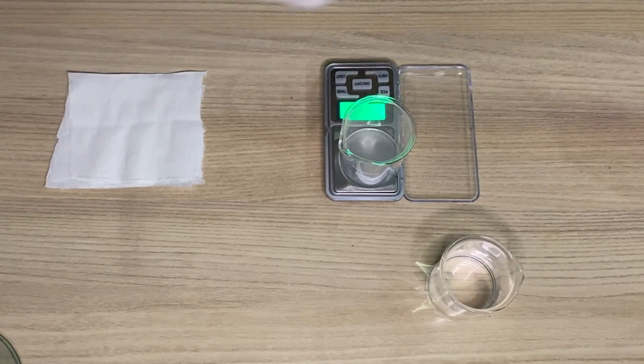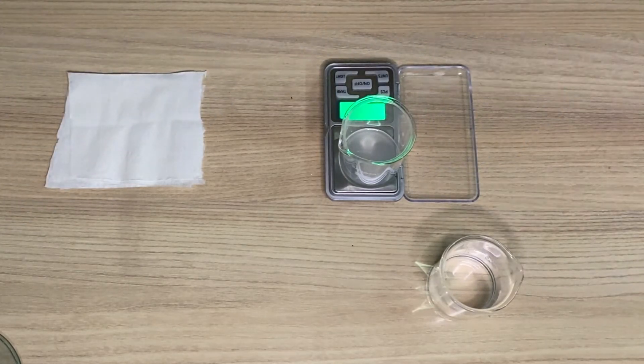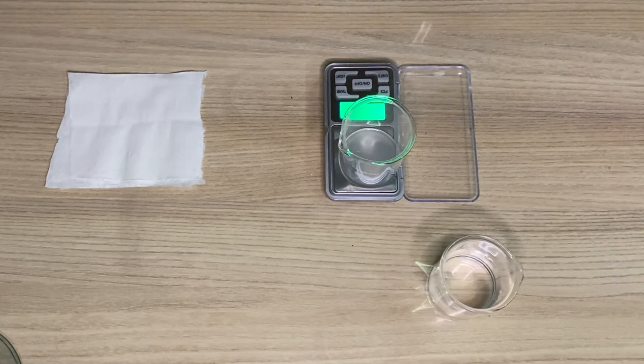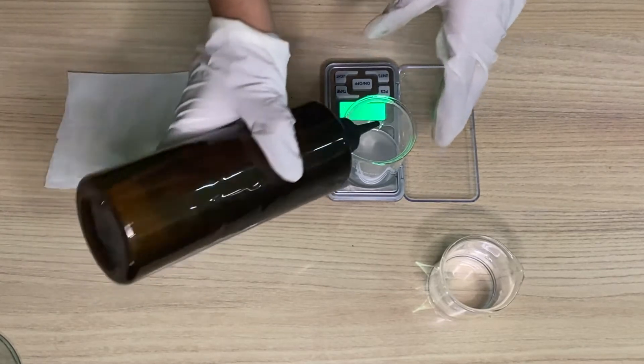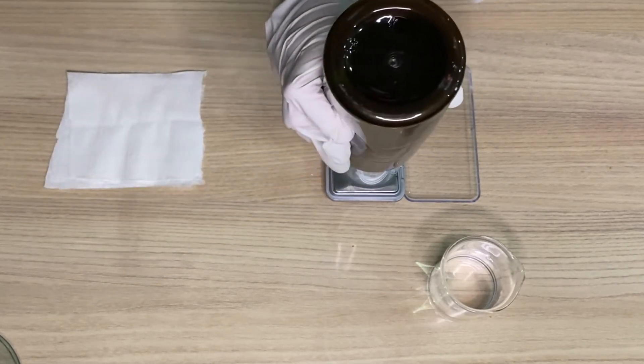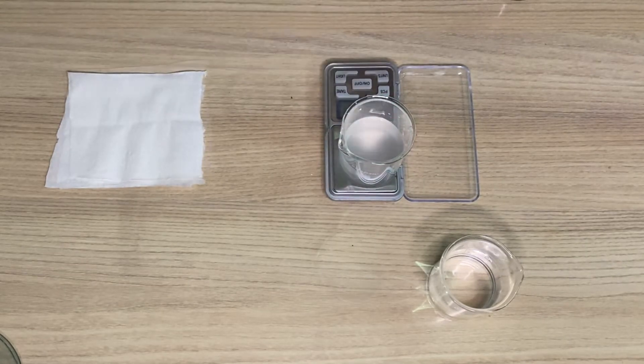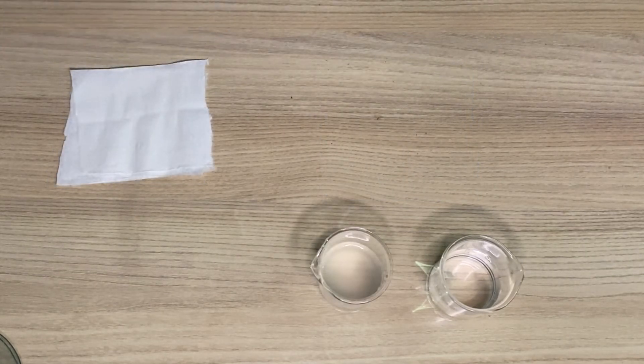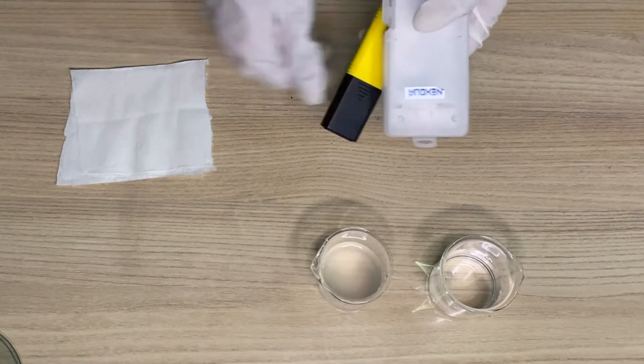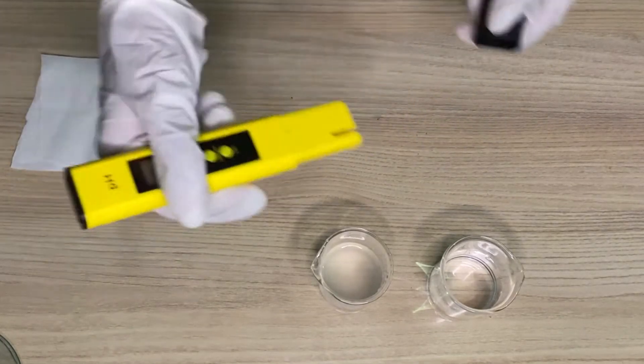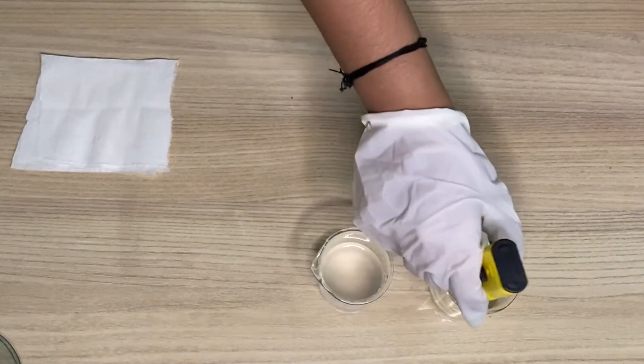And now 45 grams of water. It is a 10 percent dilution, so it will be 50 grams. The pH meter that I have is from Next Co-op. First we'll dip the pH meter in distilled water.